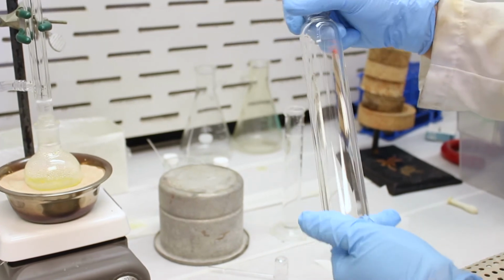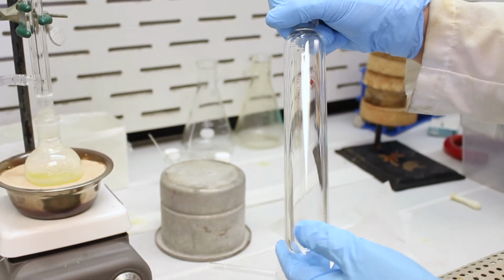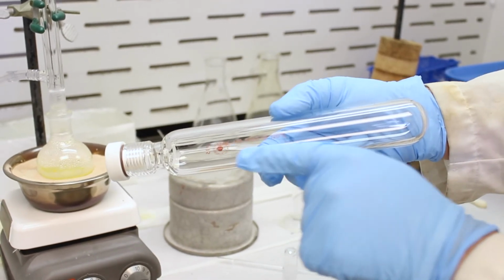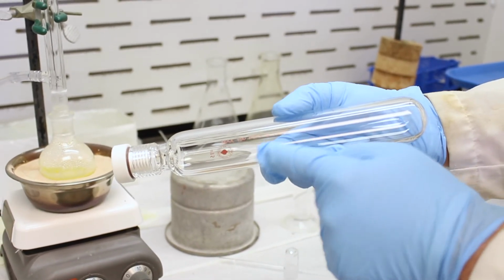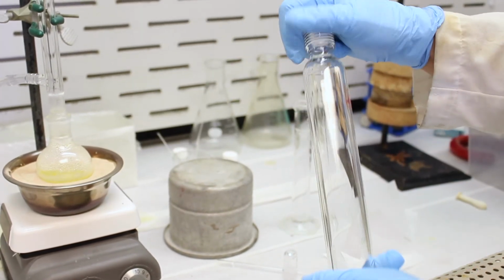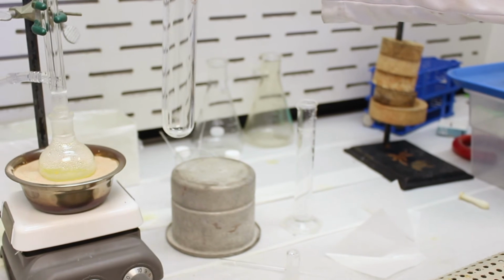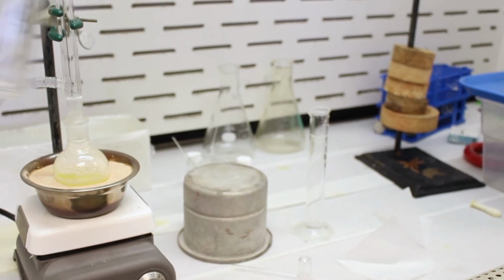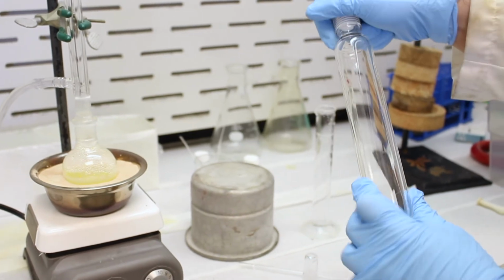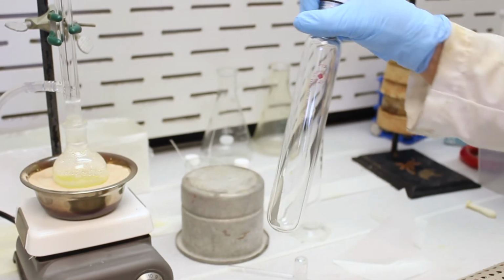So if you have the glassware, you can in fact heat things under a sealed system. So you might be able to see it's pressure rated, so the maximum pressure this is rated to is 150 psig, the gauge pressure. And normally, when you do this, you stick it in a bath, a sand bath to heat it, and then you would put a blast shield in front of it. So just in case, in the small chance that it explodes, you're safe. So just thought that'd be an interesting side note.